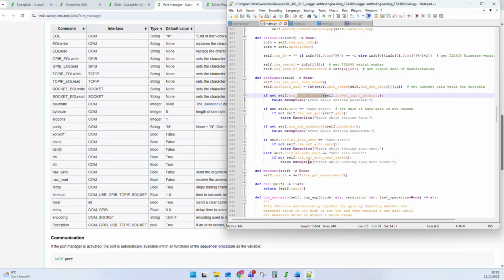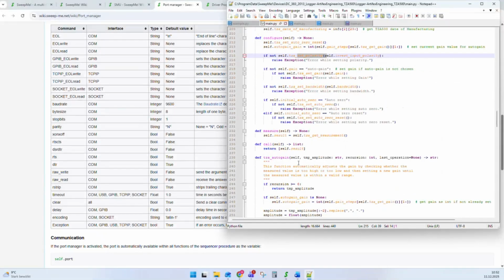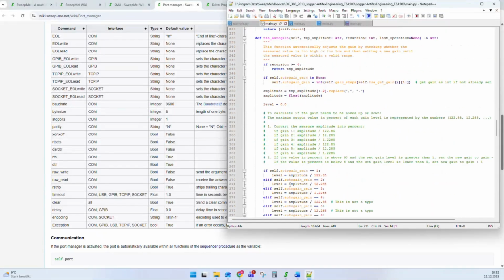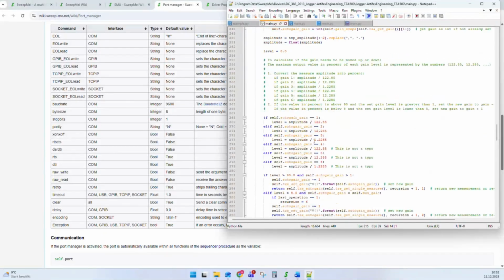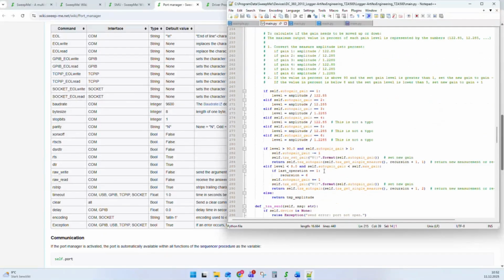So you need less and less, let's say, also comments, because the functions often have a name that makes them somehow self-explaining. The code gets very easy to read, and it's very easy to understand what is actually done in the driver. And you outsource all these additional things, like having the correct auto gain value set and so on, into a single function.